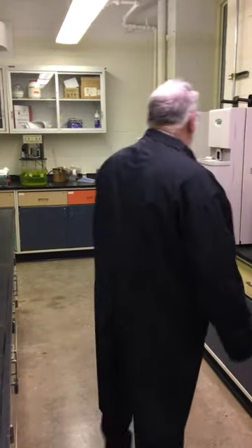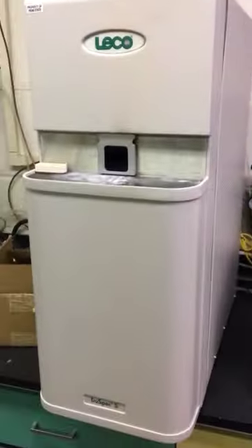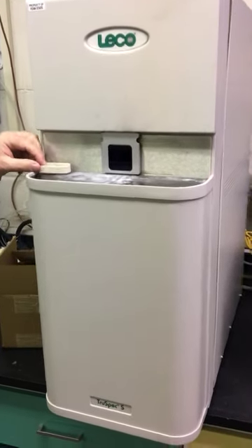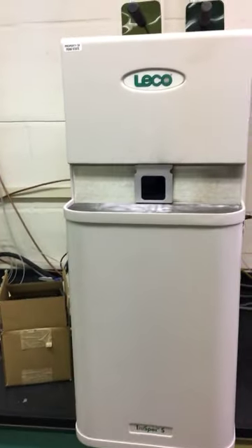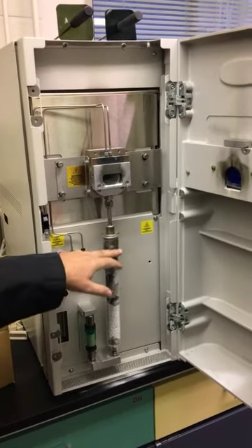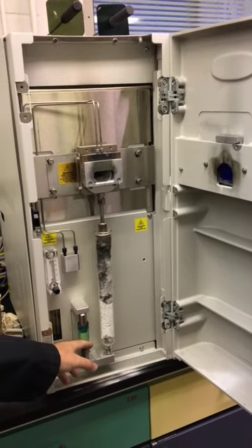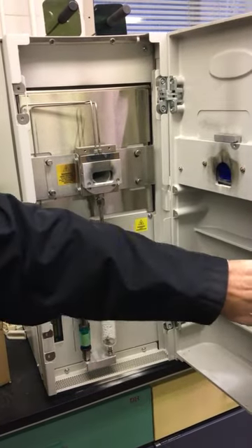So, moving on. This is the LECO TrueSpec CHN analyzer. We also have a sulfur component added in. I'll start with the sulfur as it's the easier one to do. This has a horizontal furnace. So you can see the furnace here. There are some particulate filter traps and some things to absorb moisture so those don't go into the infrared detector.